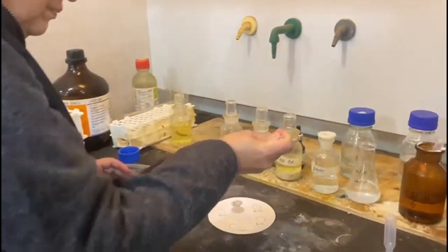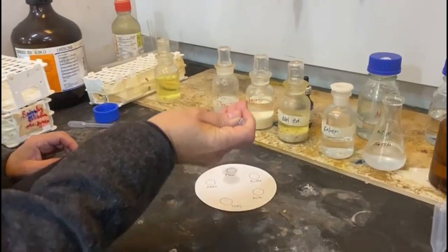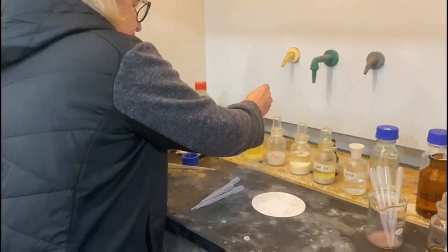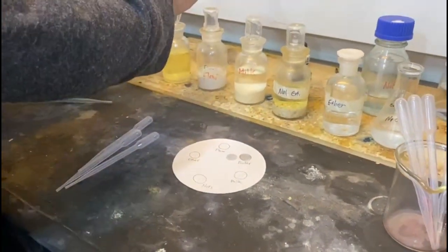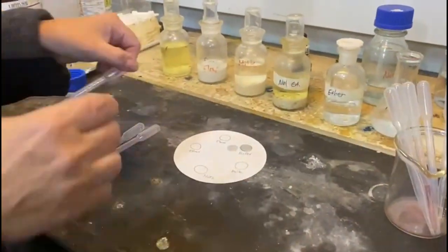Oh no. It's okay. It's still in the same location. Butter. This time I don't spill it everywhere.